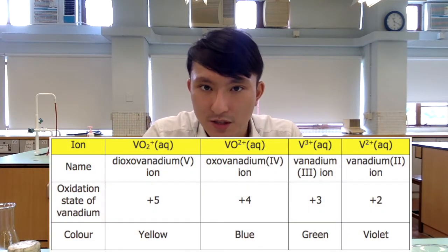It comprises a series of chemical reactions in which we are able to produce vanadium-containing species with different oxidation states. Most importantly, we are able to see the corresponding color. Before we get into the actual procedures, you need to be familiar with these vanadium-containing species.